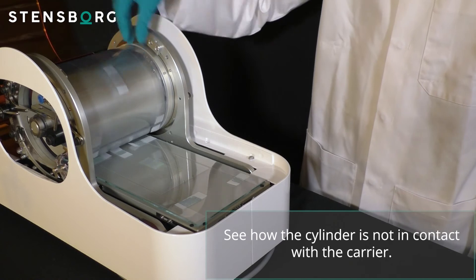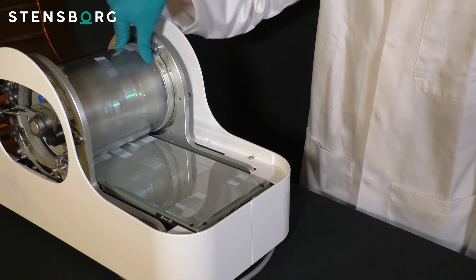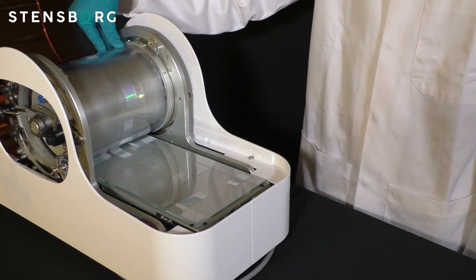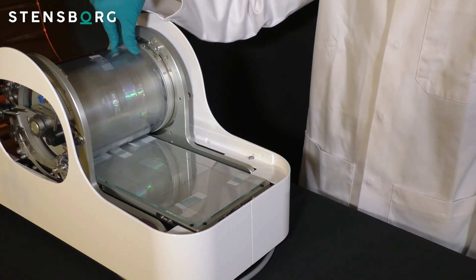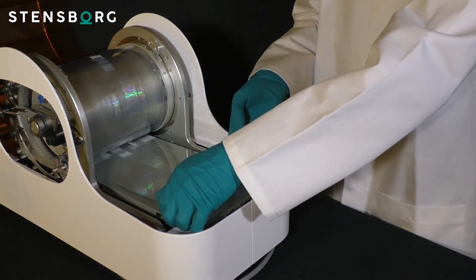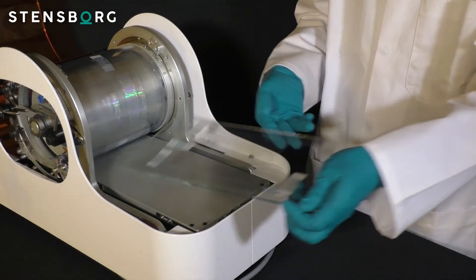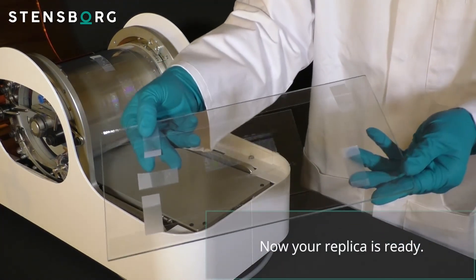See how the cylinder is not in contact with the carrier. Now your replica is ready.